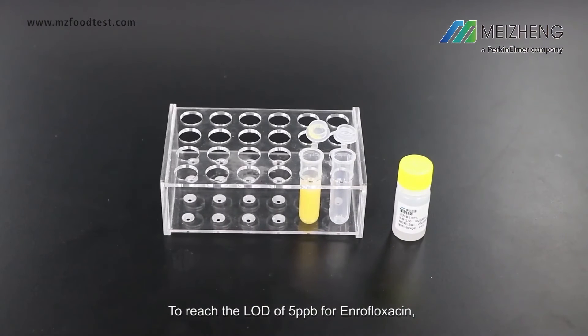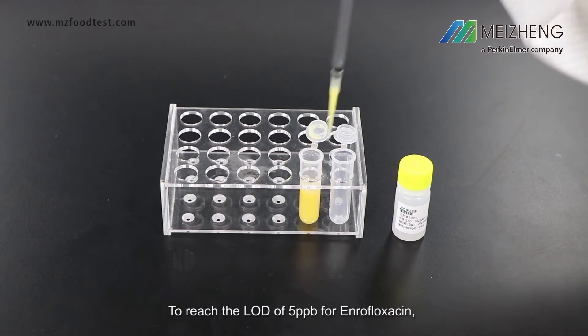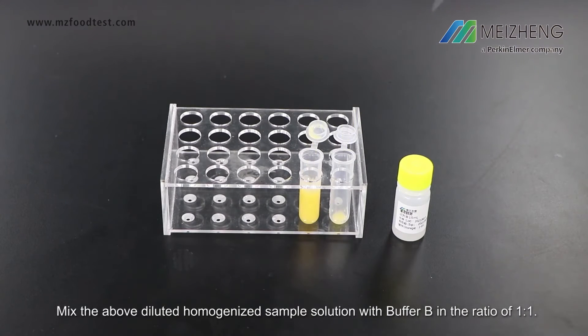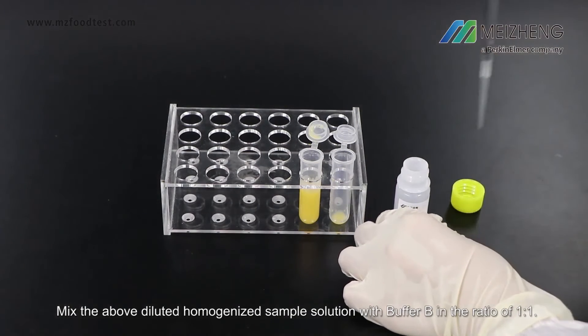To reach the detection limit of 5 parts per billion for enrofloxacin, mix the above diluted homogenized sample solution with buffer B in a ratio of 1 to 1.